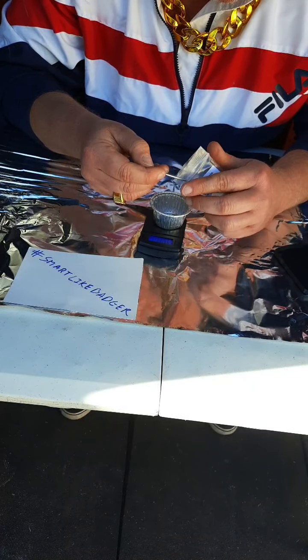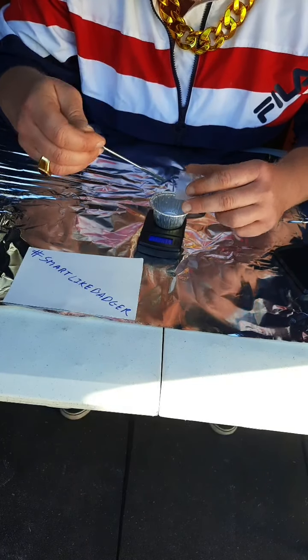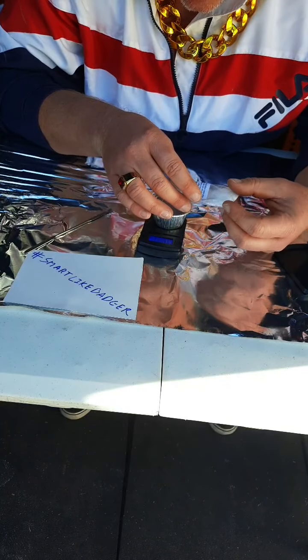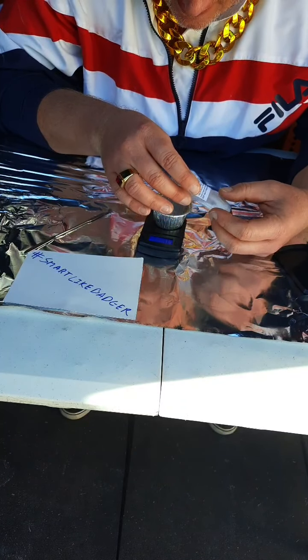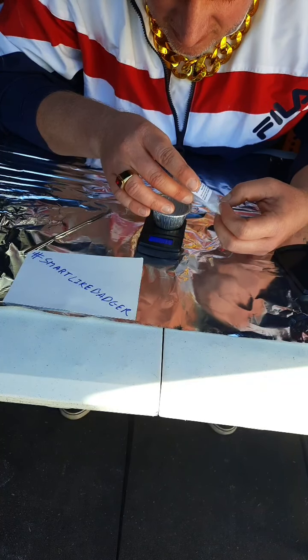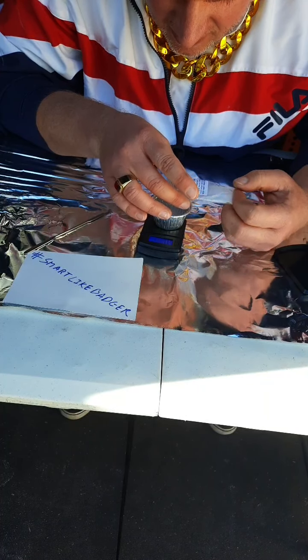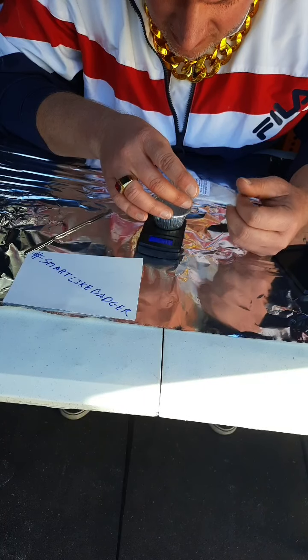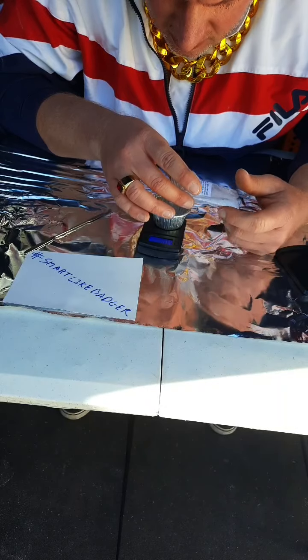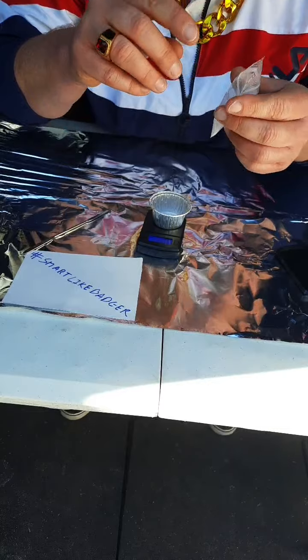Ooh, these are very hard to scoop. We try to pour some in. We pour little in. Okay. Oh, Boris gets 1.9 grams. 2.0 grams.